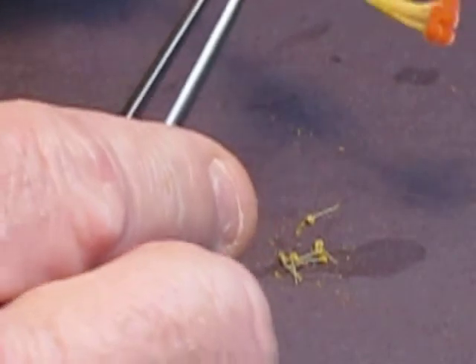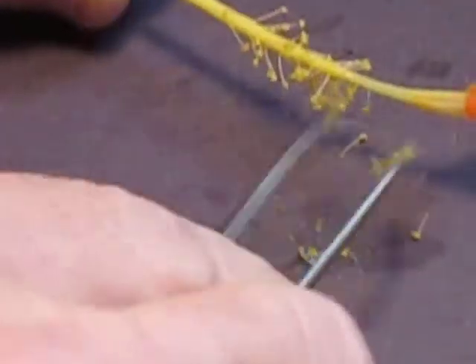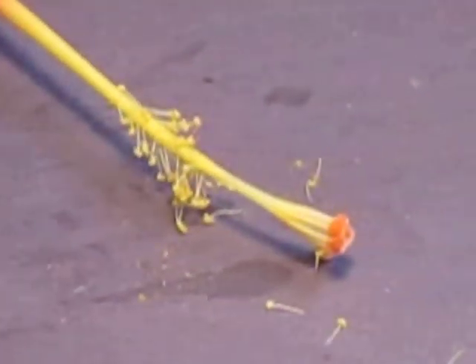And if you have trouble remembering which one is the male part and which one is the female part, stamen ends in the letters M-E-N, and therefore that must be the male part. All right, the other part of the flower I should say, is the pistil.